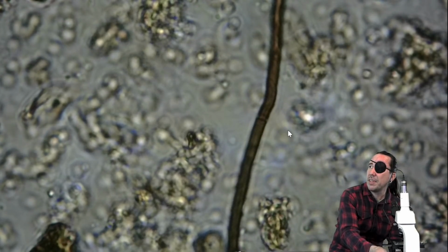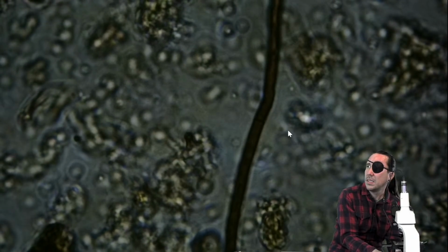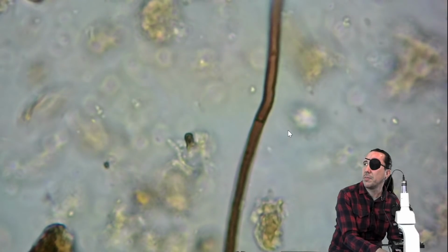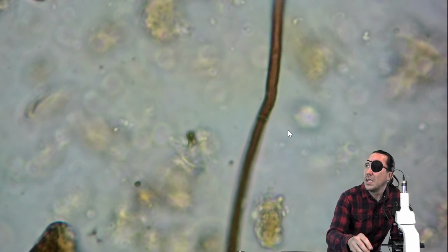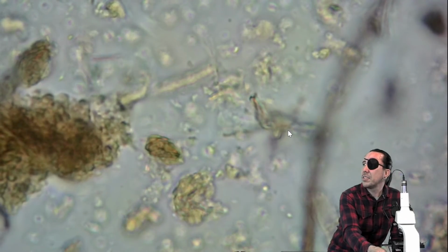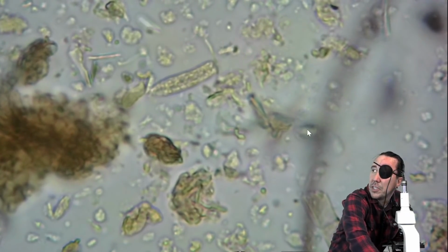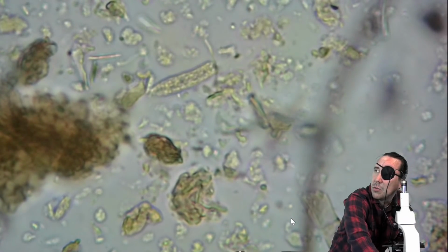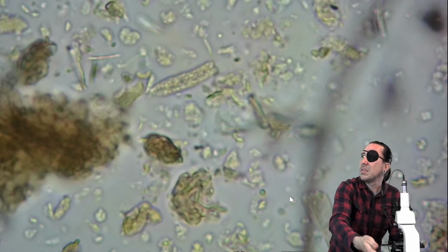And let's shadow real quick, and we'll see if we have any flagellates in the background. Oh, it's already pretty shadowed. I'm just messing with my light real quick. It looked like there might be a flagellate bumbling right near my shoulder here. It's not moving too much, but that right there, I was guessing. But it looks maybe more like just something that's buzzing with the sample.